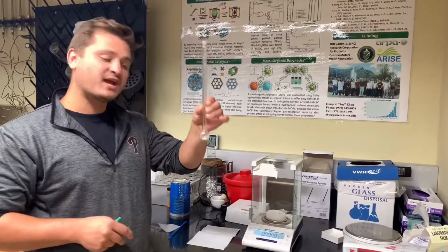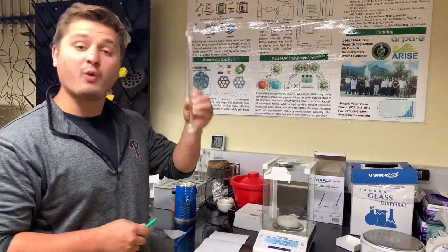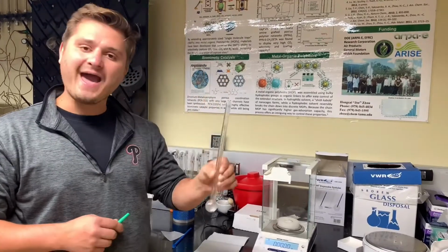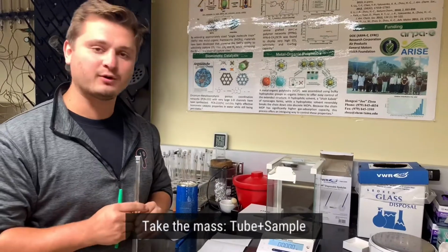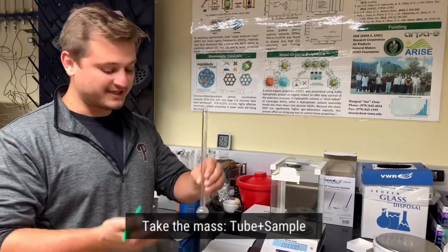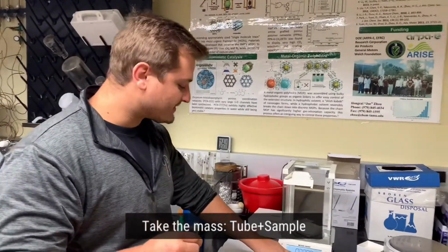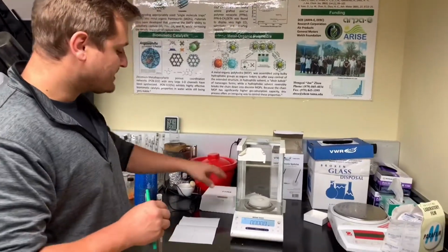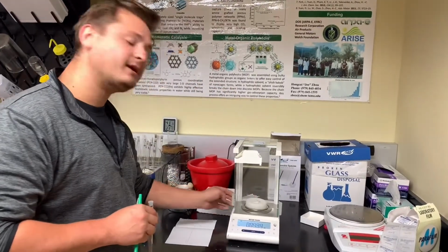So now that we have our sample tube, as we had the weight of the empty tube, in order to get the weight of the sample, we need to take the mass of the tube plus the sample, and we'll subtract the empty tube from the tube plus the sample in order to get just the mass of the sample. So, as we did before, we will make sure that the scale is zeroed and that the tube holder is centered on the scale.